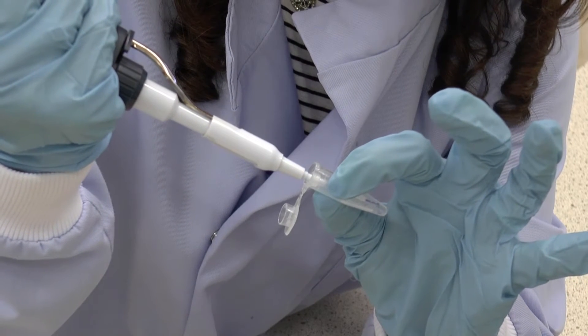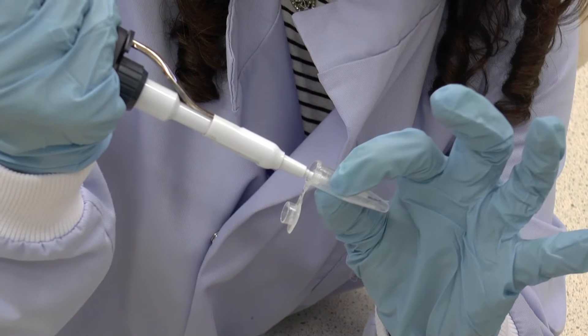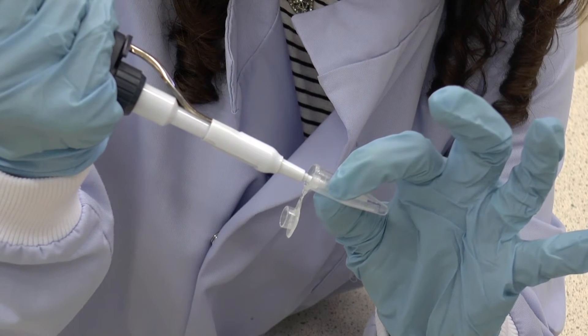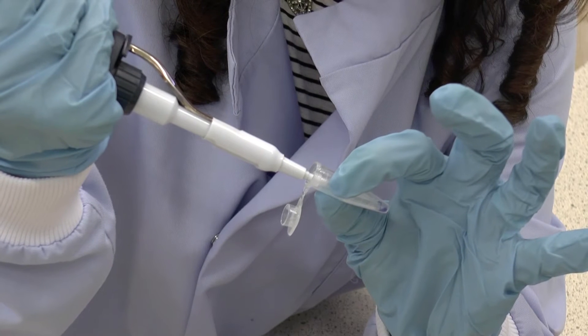I've inserted my pipette tip just under the surface of the water and I'm going to eject my enzyme carefully.